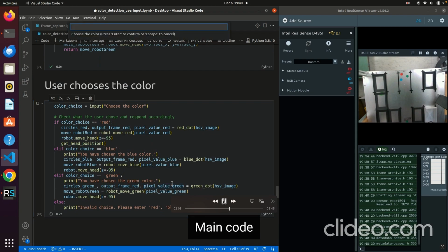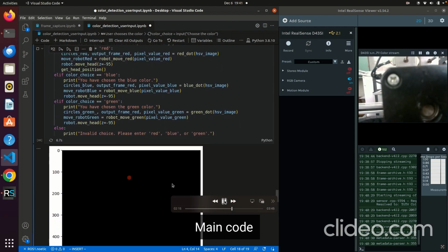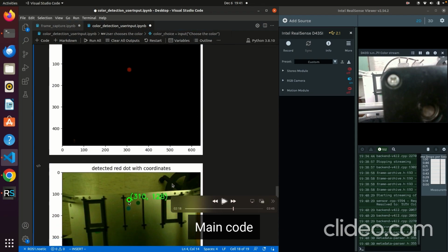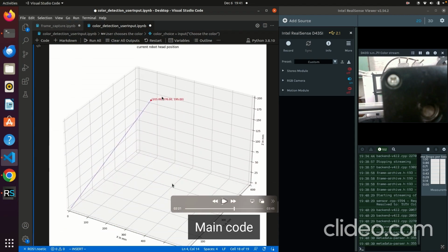Now, here, as a test, I'm going to write red. And please note on the right side, you will see the robot arm coming to the red dot. So here, as you can see, this is the circles red, the masked output. This is that pixel red frame. You get the value and you get the red dot. Here, the arm is going to touch the red dot. And this is the robot. It moved to this color space, to this area, to this spot.